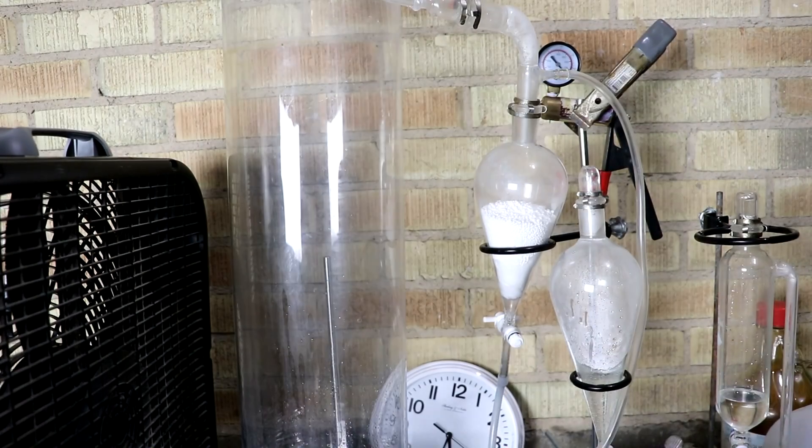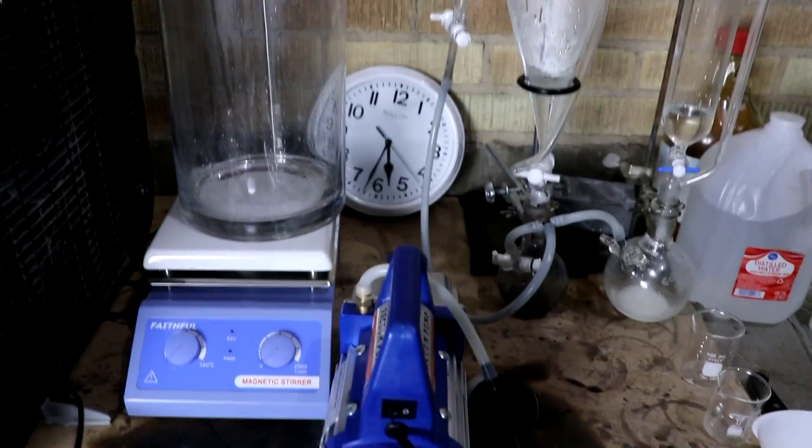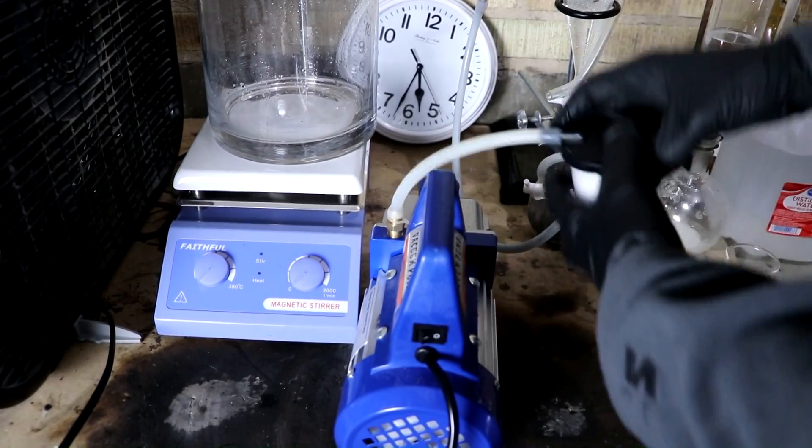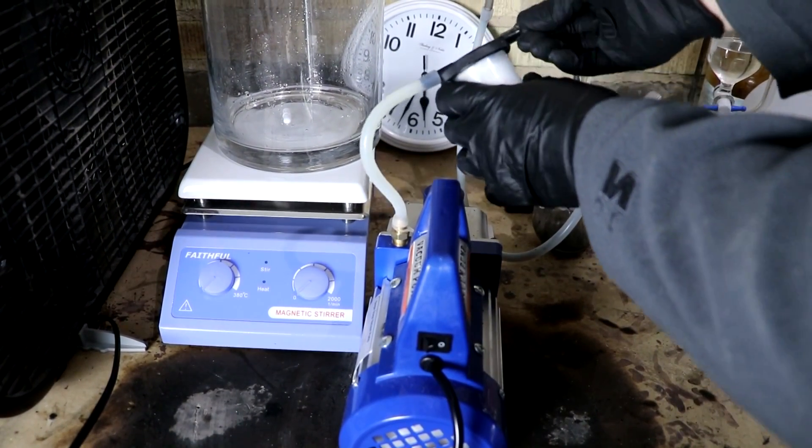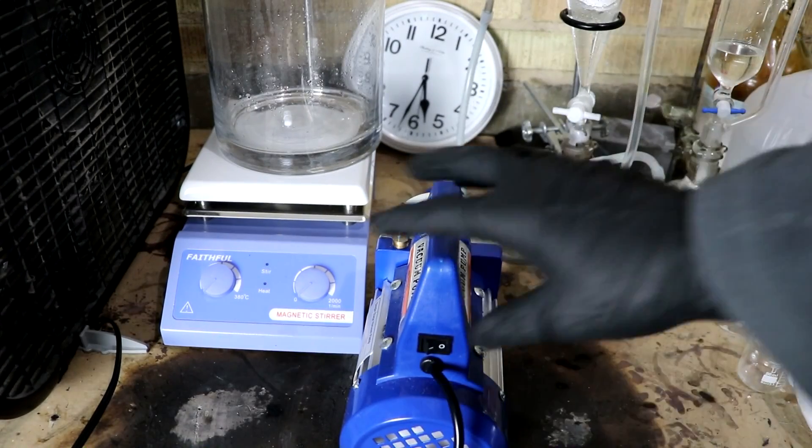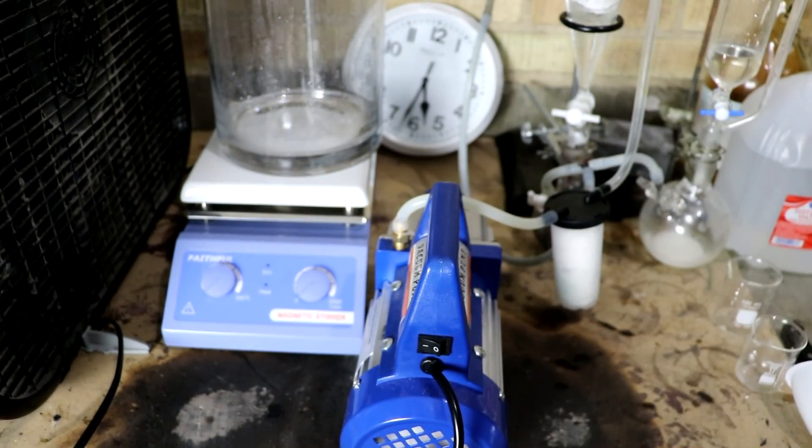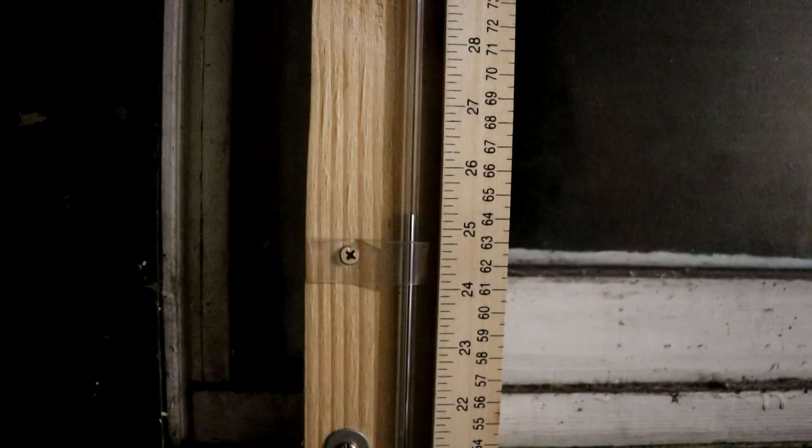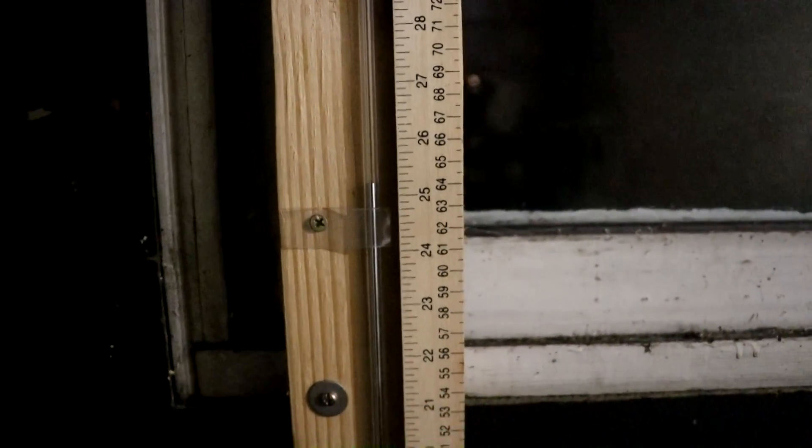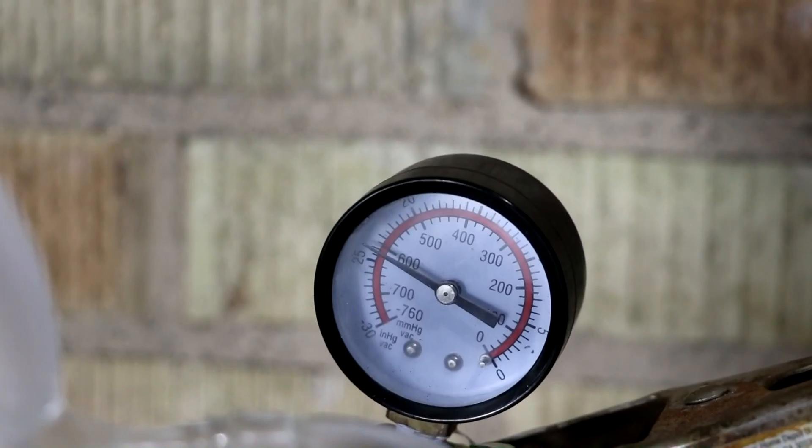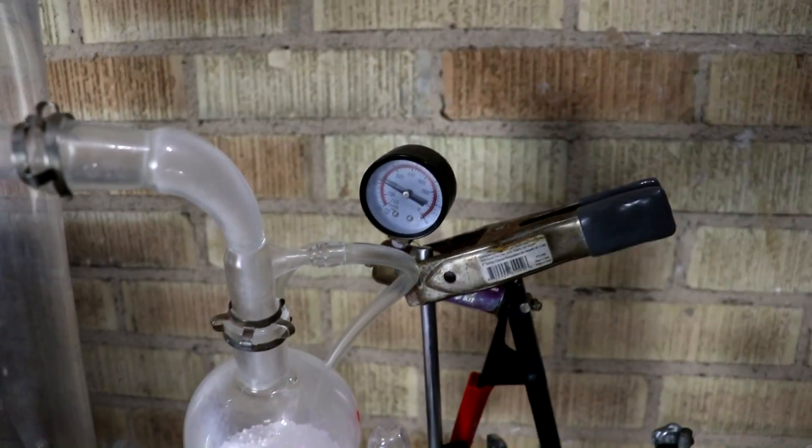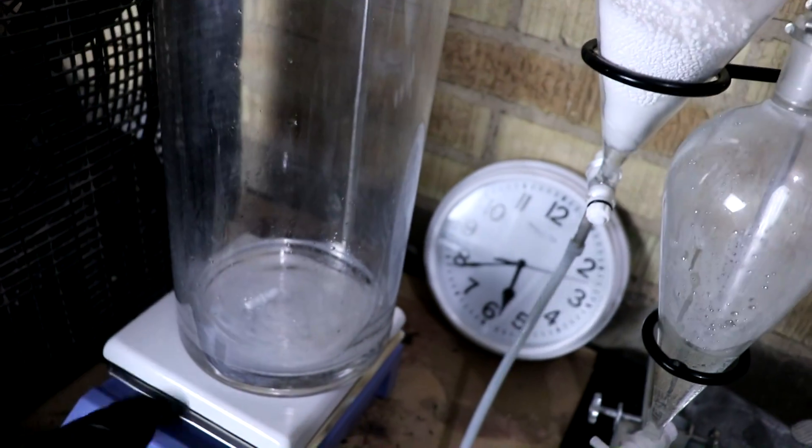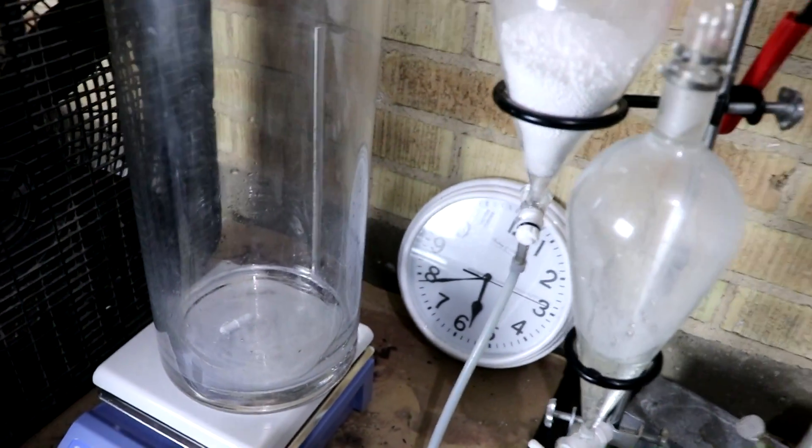So to make things a little bit easier on me, I'm going to suck out all of that air so that I can replace it with pure oxygen. The air pressure right now is just over 25 inches of mercury. The gauge here is reading almost 25. I would expect it to not be a full vacuum because there's a bunch of water and stuff in there.